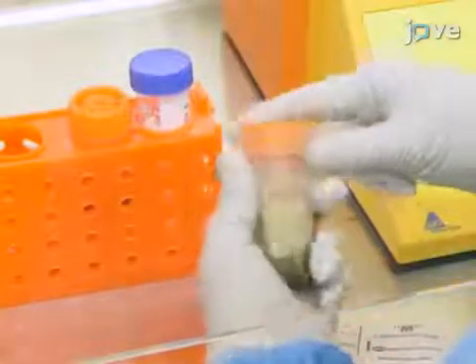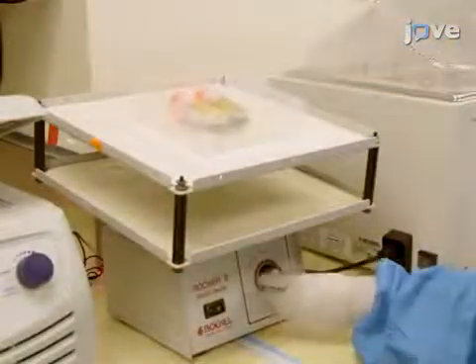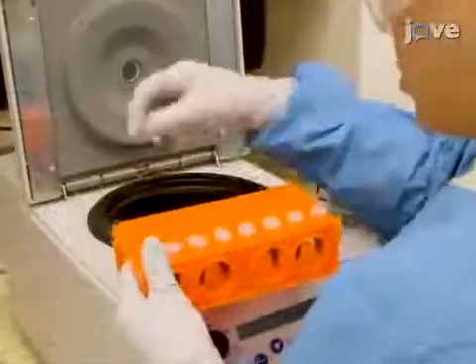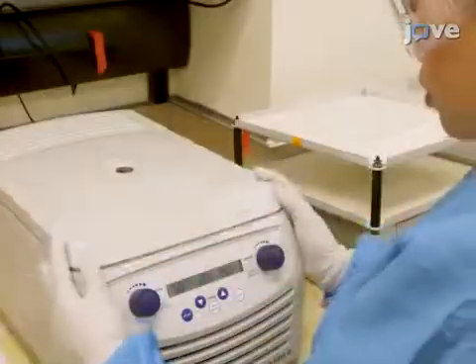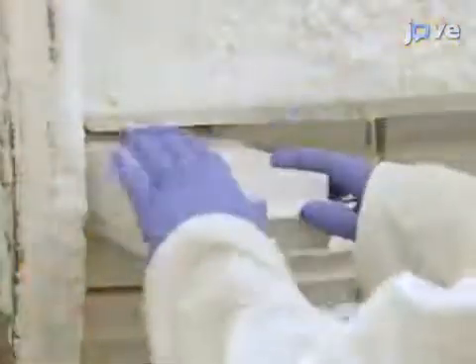Then use parafilm to seal the tubes and place them onto a rocking platform or rotary shaker for a one hour incubation at room temperature. After this, centrifuge at 18,000 G's for five minutes at room temperature. Collect the supernatants and aliquot them into 1.5 milliliter tubes. Store at minus 80 degrees Celsius until ready to use.